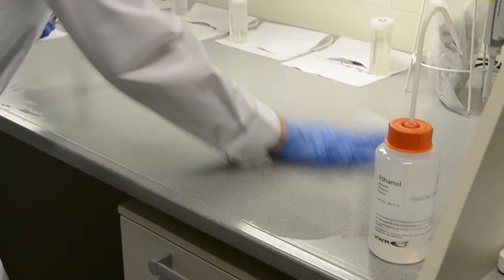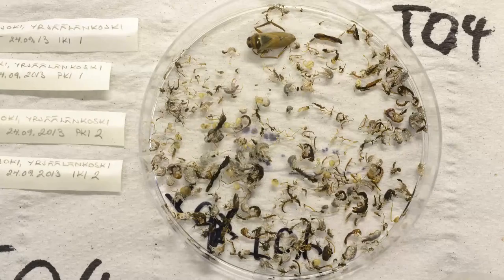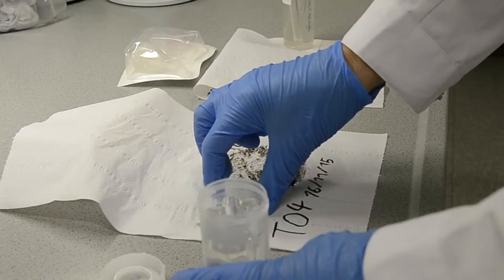We use new, fresh gloves for each sample to prevent cross-contamination between samples. The next morning, all needed equipment is cleaned again with ethanol. And before we get started, a picture is taken of the dried specimens including the labels from each kick sample.